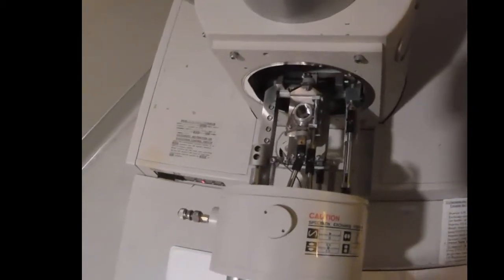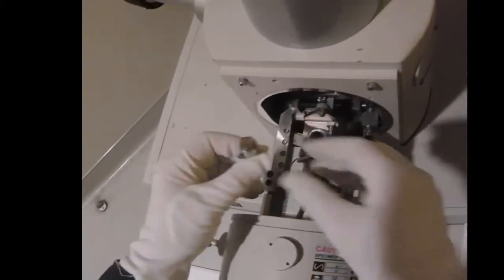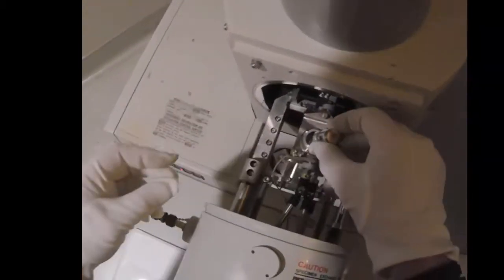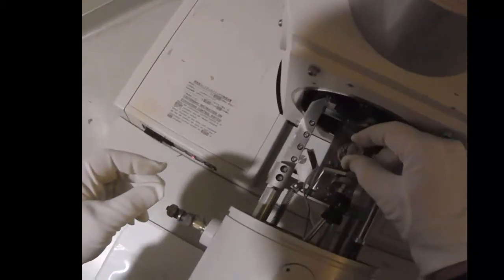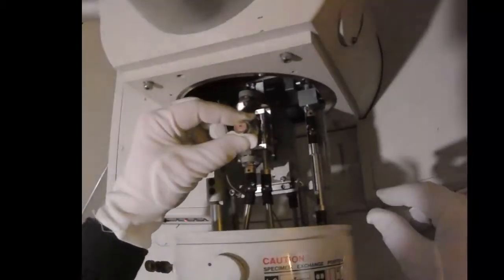This is kind of awkward. It rotates on this arm here. So this is where the sample holder goes. Press down in there.